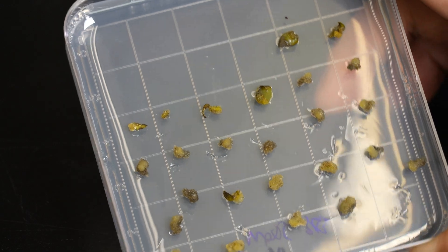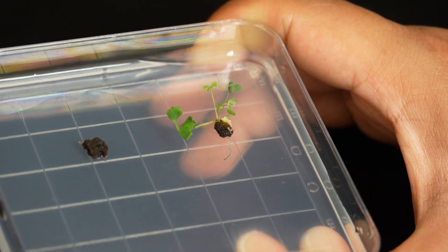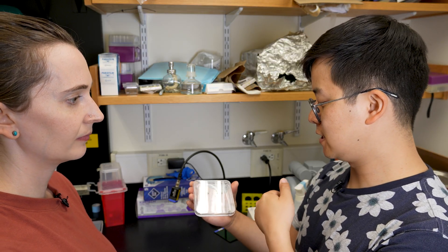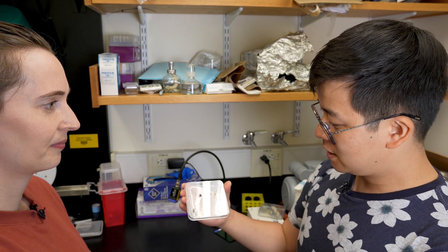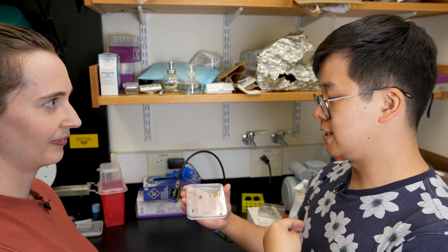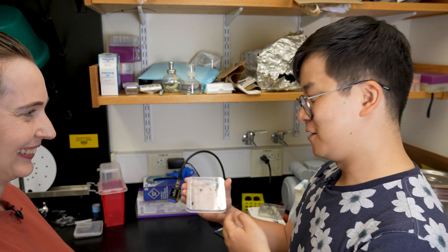From looking at these blobs, we know the green ones are positive. That tells us they're good candidates to now put onto the new medium with all the hormonal signals, because having the green also means they probably have the developmental gene. And then once they go onto the media with all the right hormonal signals, they'll be able to regenerate shoots and roots properly with the help of these genes. Now with this, it will really help us to put in various different genes of interest to look at the genes we care about — where are they going to be expressed, and when we overexpress or mis-express them, what kind of phenotype do we see? That will help us to understand how those genes are functioning in this context, and now we have hundreds of genes to look at for their function.